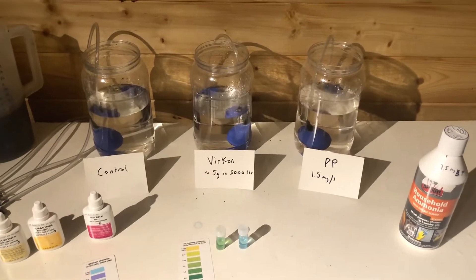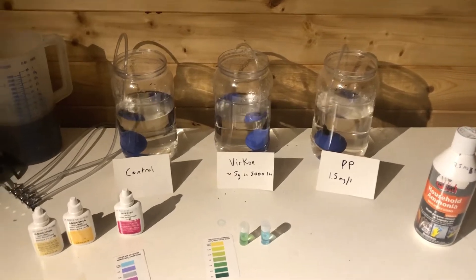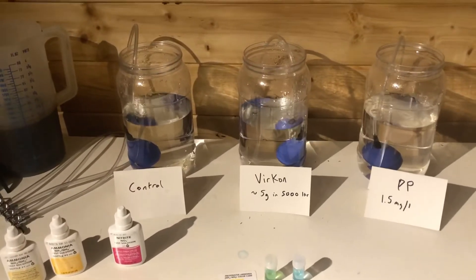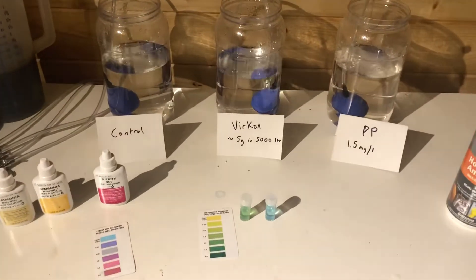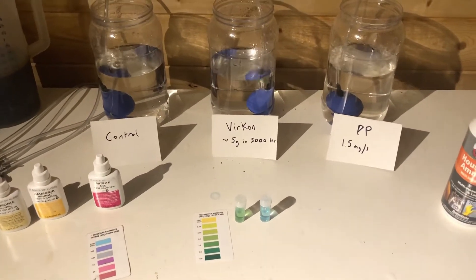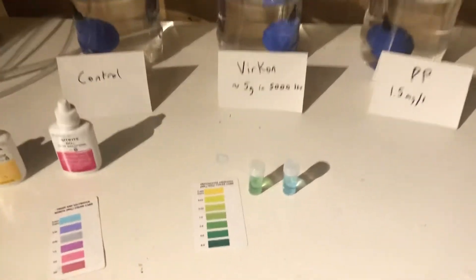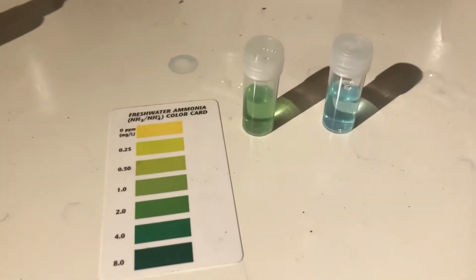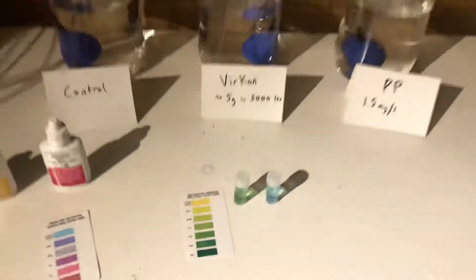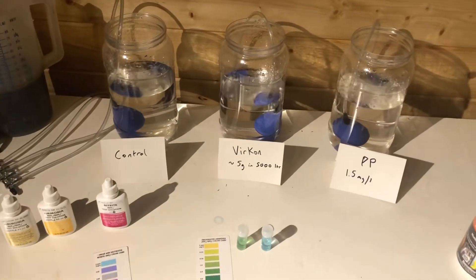So what I've done is taken the water out of the pond, put it in a bucket, aerated it overnight with some media in there to remove all the ammonia and nitrite, then tested how much nitrite and ammonia was in the water — it came out at zero. I've then added some ammonia, tested the water again, and we've got about one milligram of ammonia in there and zero nitrites. So we're all ready to go with the experiment.